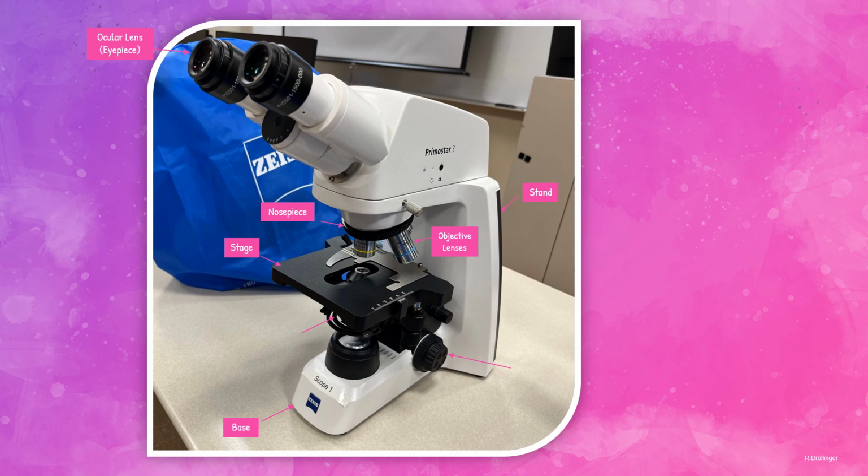This is the condenser, the purpose of which is to focus the light onto the specimen. And of course, here is the light source. We also have a light control, which is here. This controls how bright or dark the light coming from that light source is going to be. Then the fine and coarse adjustment. The coarse adjustment knob is used to bring the specimen into near focus. The fine adjustment knob is used to sharpen the focus quality of the image of the specimen after it has been brought into focus with the coarse adjustment knob.